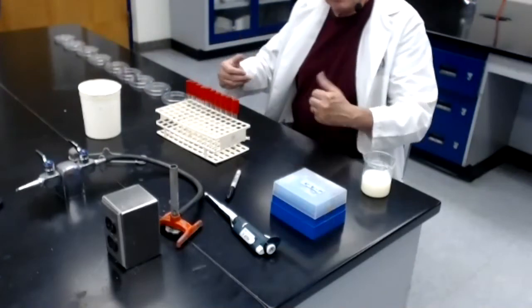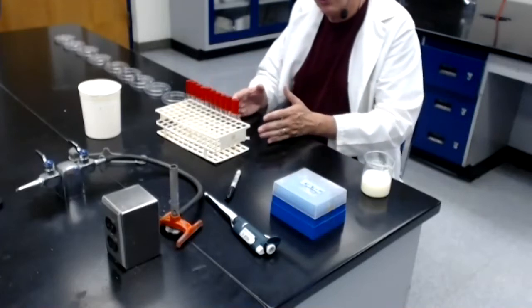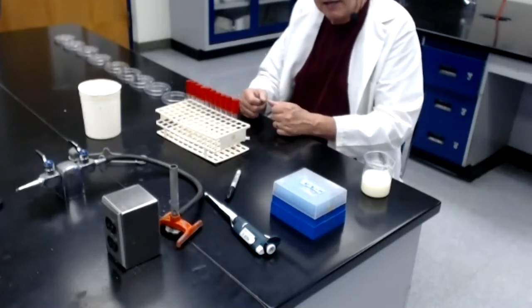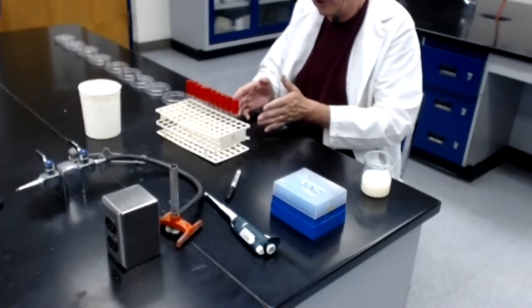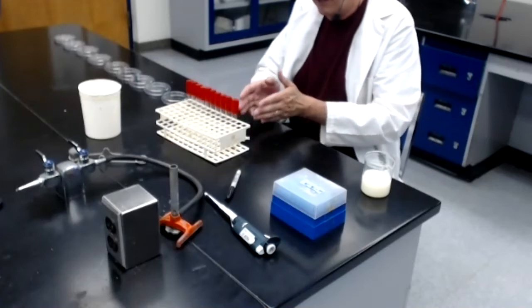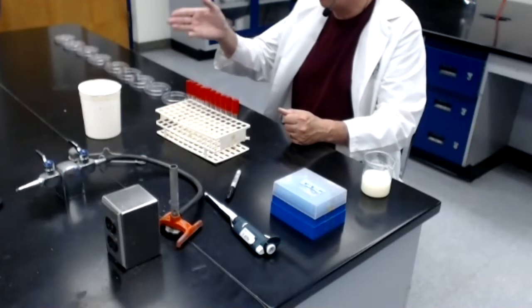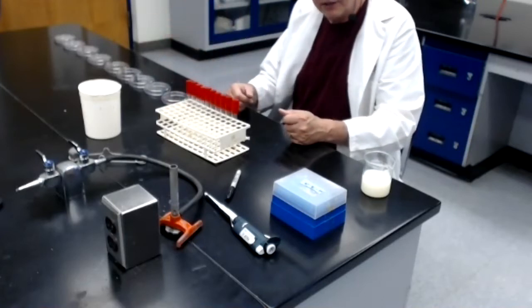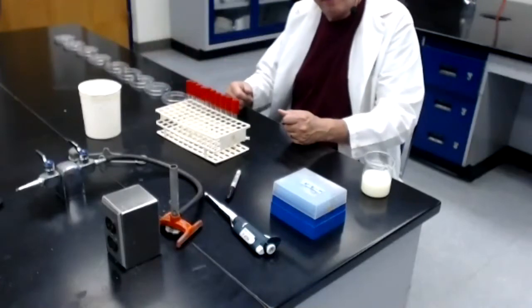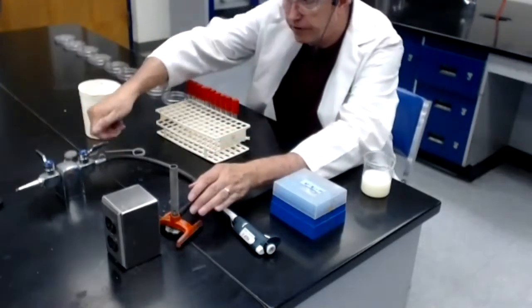So let's go through the actual workings of the protocol. I am only going to demonstrate the first 2 or 3 dilutions on screen, and then off screen I'll finish the dilutions, and then I'll come back on screen to show you how we're going to transfer the samples from each dilution tube into tubes of melted agar, and then pour those tubes of melted agar into the correct sterile empty Petri dishes that are lying here on the bench. So the first thing I need to do is fire up my Bunsen burner.